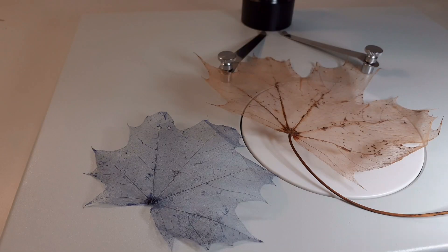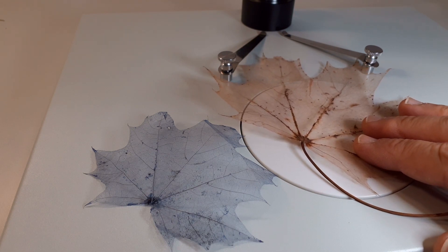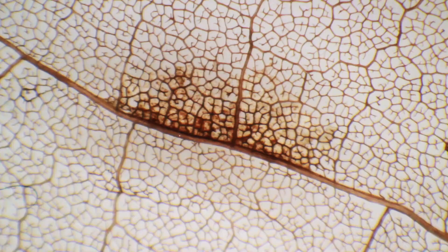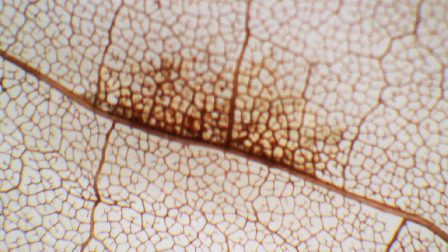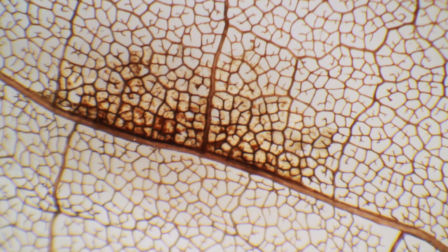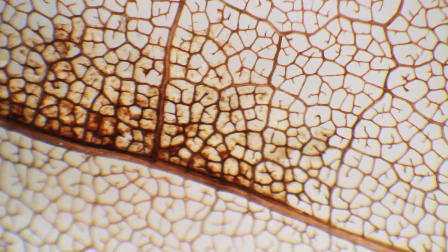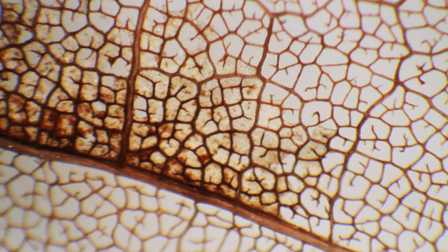Of course, I also have now a new stereo microscope, which makes me quite happy. So I placed it on the stage of the stereo microscope and did a little bit of observation this way — this is what I'm going to show you right now. This is now under the stereo microscope. I've got a zoom function in my stereo microscope, so I'm turning the zoom knob. At the same time I have to focus, so I have to turn two knobs at the same time, and if I don't do that with the right speed, the image can go a little bit out of focus.